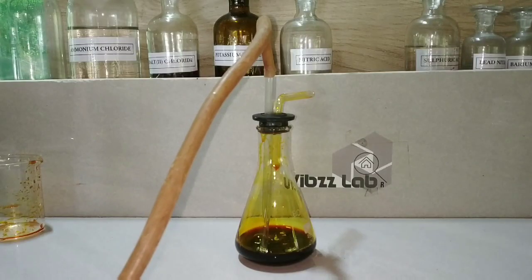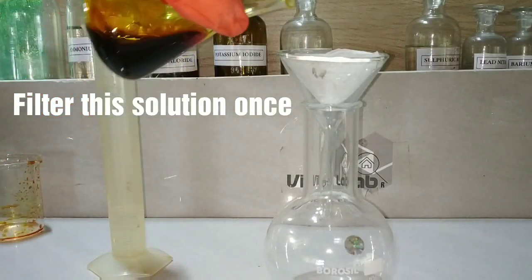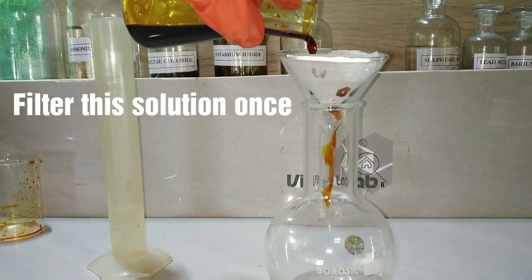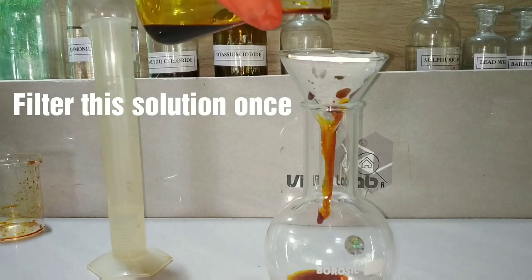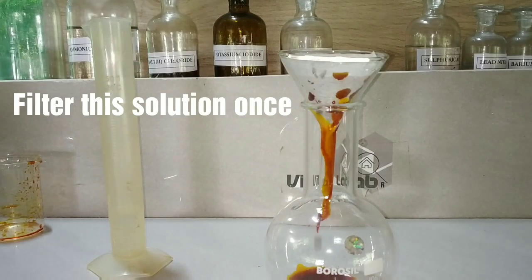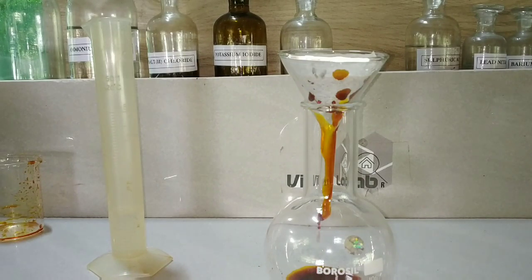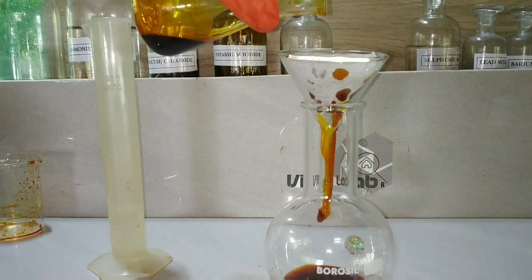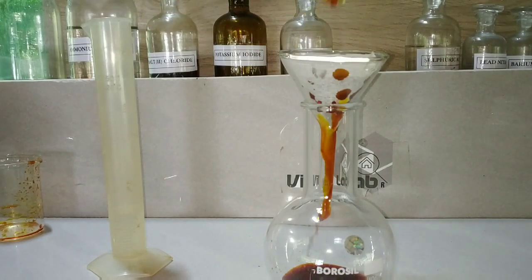No more gas is evolving, which means the reaction is complete. We now filter the solution. The filtrate is already sodium cobaltinitrite solution, which we need to concentrate to obtain the crystals.